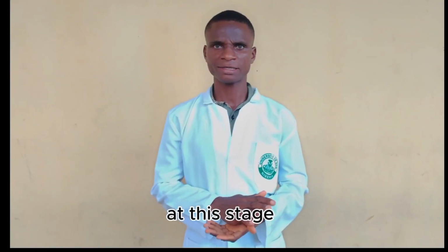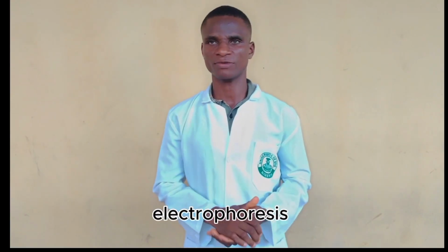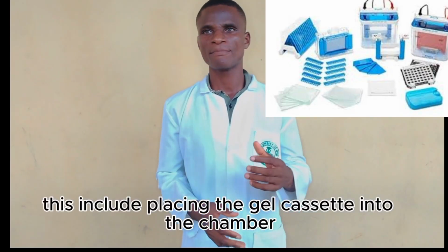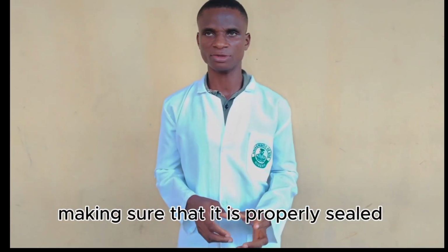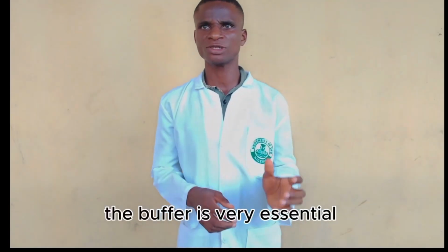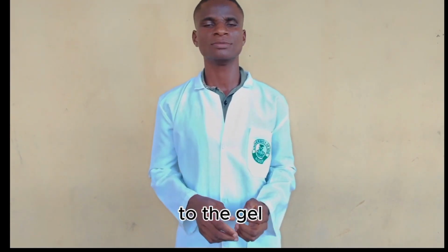At this stage, we are diving into how to run the polyacrylamide gel electrophoresis. First, we need the electrophoresis apparatus. First thing we need to do is assemble the electrophoresis tank. This includes placing the gel cassette into the chamber, making sure that it is properly sealed. After we have done that, we need to fill the chamber with the appropriate running buffer. The buffer is very essential because it provides ions that carry the electrical current through the gel.